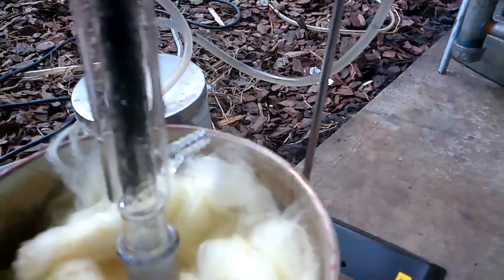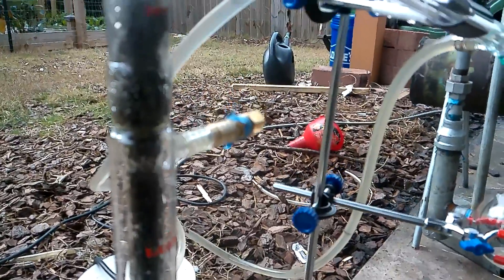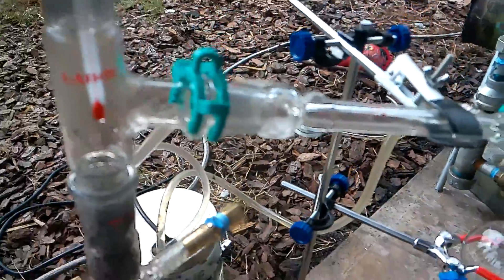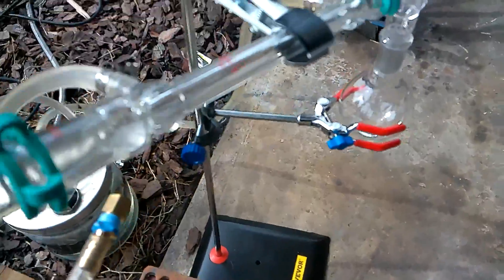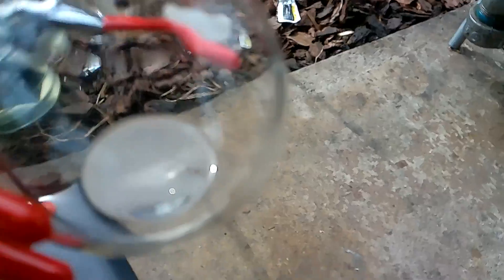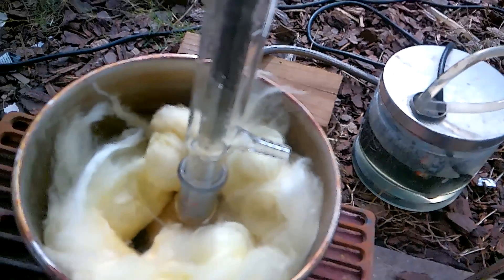There's some pretty intense reflux occurring in the flask here, and this packed column is working very well — having multiple areas of high surface area. The vapor temperature right now is at 40 degrees Celsius. It's clear like water, but I don't think it's water because I can see a rainbow forming in it — you know how oils always have those rainbows. We definitely have a nice steady boil going with a lot of bubbles in there, so it's looking good.